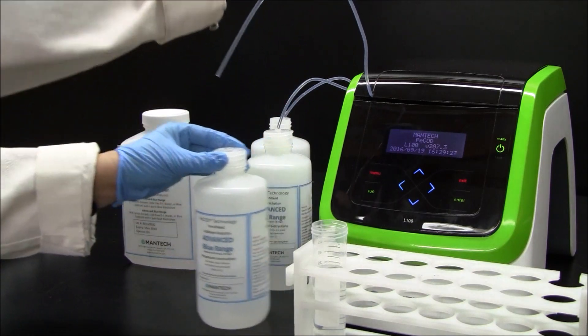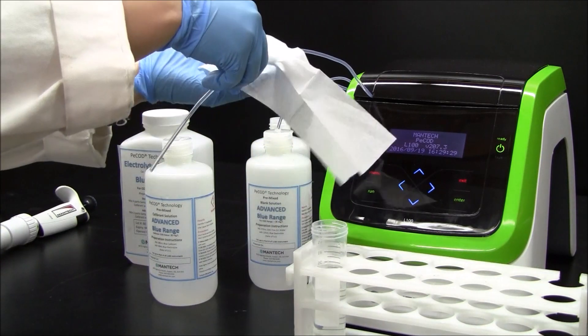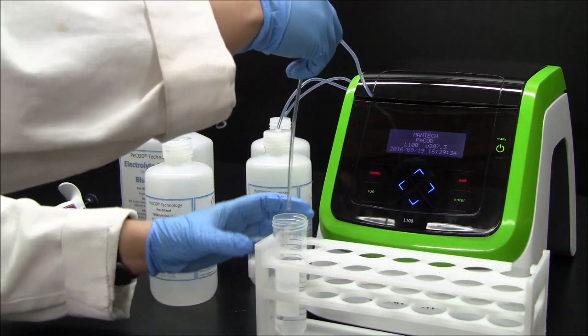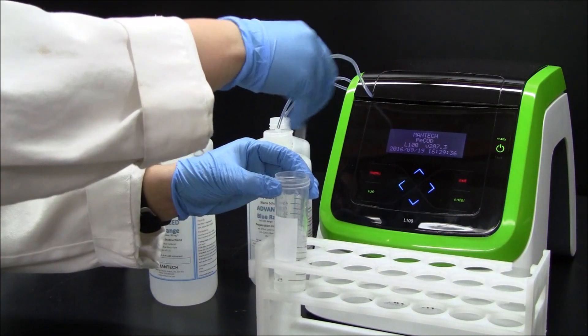Wipe the tube from port A. Present the sample to port A and mix thoroughly.